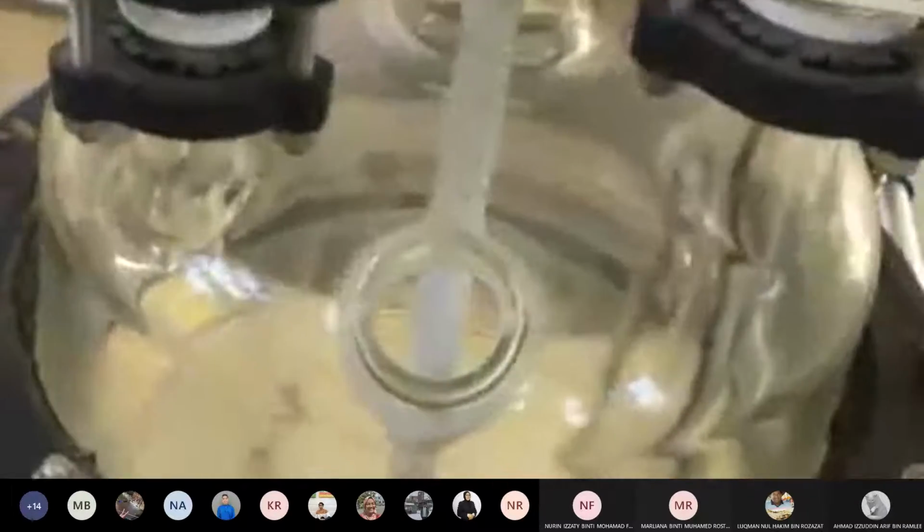If you read the lab manual, by right, for experiment 1B. Experiment 1A does not use this batch reactor. Experiment 1A is only done in a beaker, or I would say experiment 1A is lab scale. Experiment 1B, we really use the reactor. For those doing experiment 1B, you study the effect of temperature.